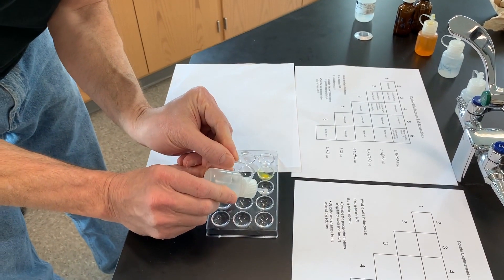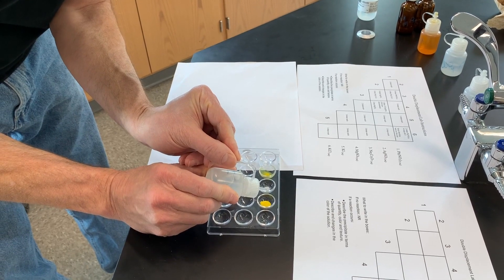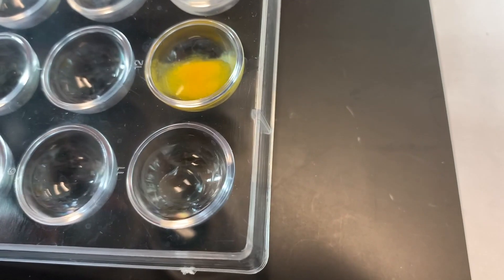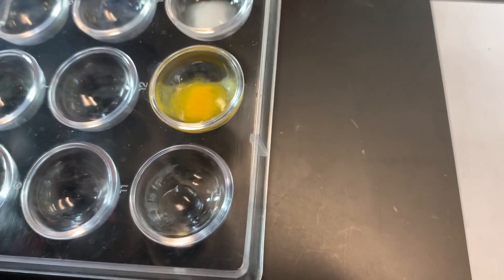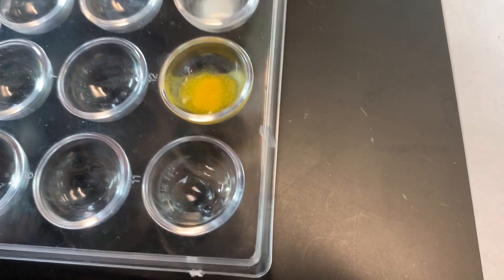Okay, now a few drops of potassium iodide. That's pretty clear—we're getting a yellow powder, a little bit thicker. The liquid appears colorless.